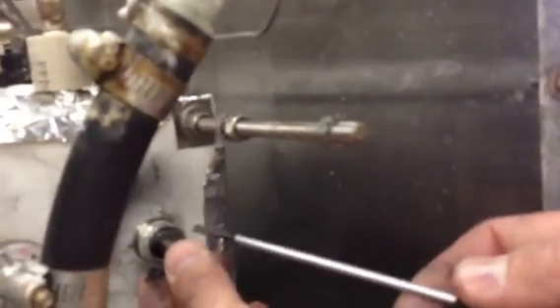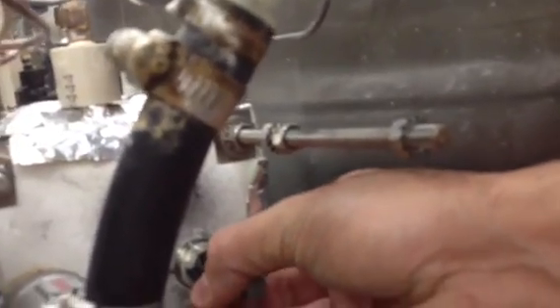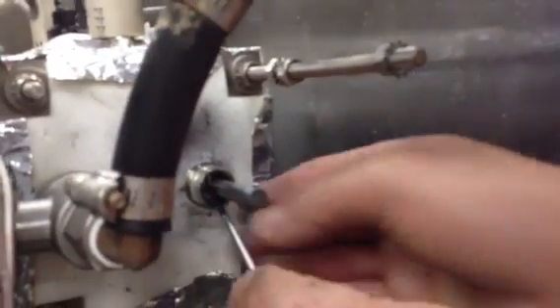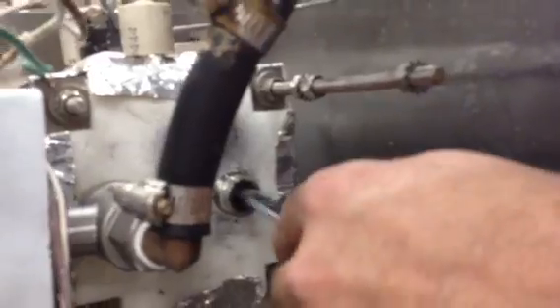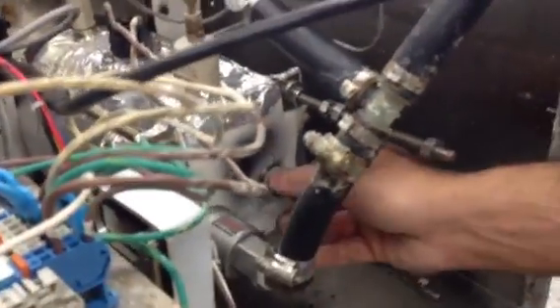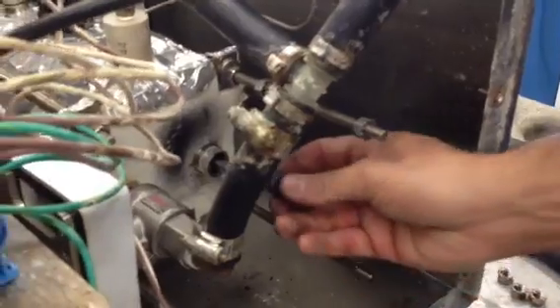And you can use a small screwdriver, again the one that's sent with the machine, and you very carefully push up on the rope, and you just have to keep pressing to get the rope up inside the nipple. You slide it as far up as you can get it. At the end, we'll use the packing nut and the bushing to compress everything. So if you can slide it up as far as you can.